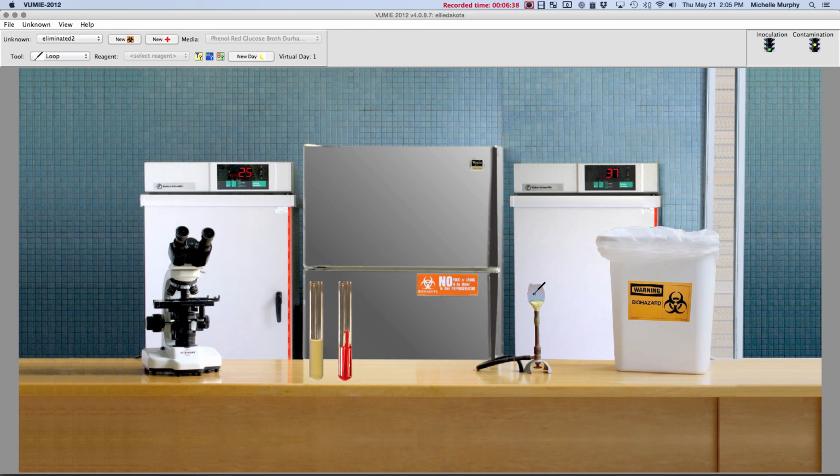Okay, I'm going to flame my loop. I'm going to flame my test tubes again. Pick them up with your mouse. Get them both. Media flamed, inoculum flamed. I'm going to put the lid back on. Turn off my burner. It acts just like you're in a real lab, so that you get used to the steps and you can do them automatically. Okay, I'm going to put that into the incubator. I need to let it sit for 24 hours, so new day. Right click on my incubator, pull that out.